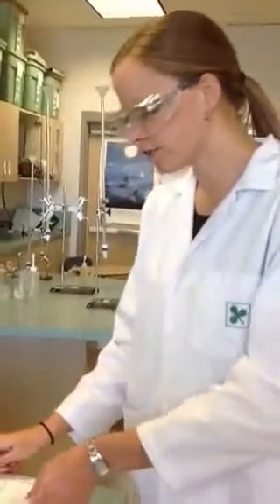Make sure that you calculate it before you panic and throw out your value. From there, you're going to do your calculations — if you're within a five percent error, then you can go ahead and do the next titration, which would be your diprotic titration, and that should do it.